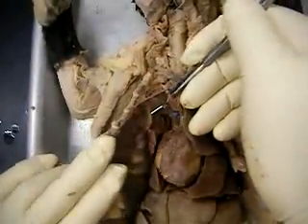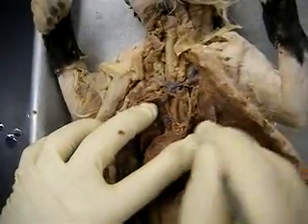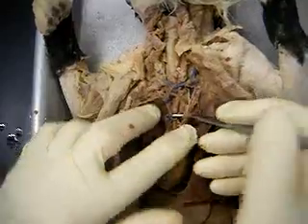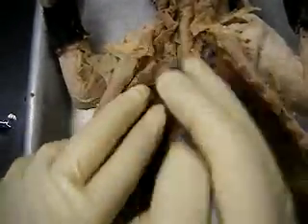Now basically starting right here, after the carotids, that part is the same as this part. So if you cut out this part and paste it after the carotids, those are symmetrical. Does that make sense? Okay, that'll help you remember that.